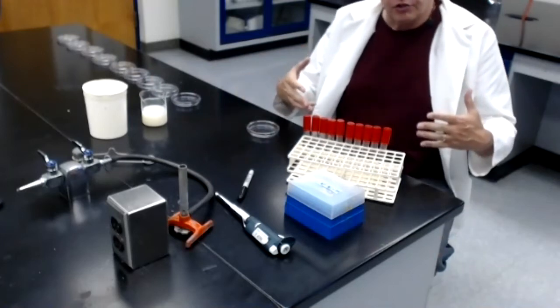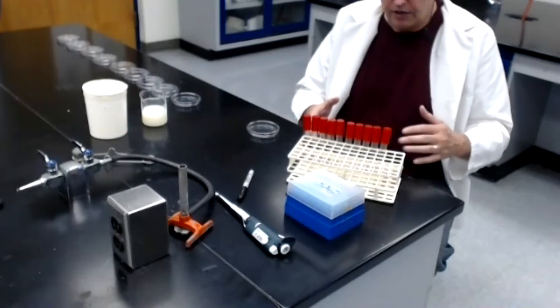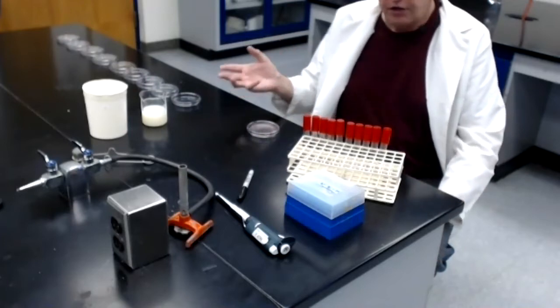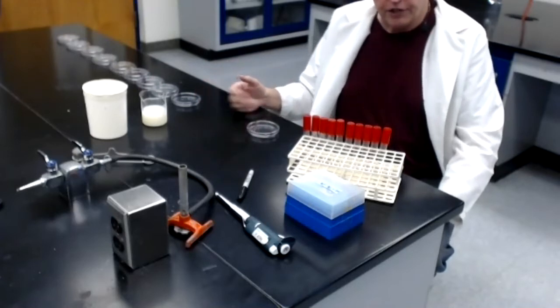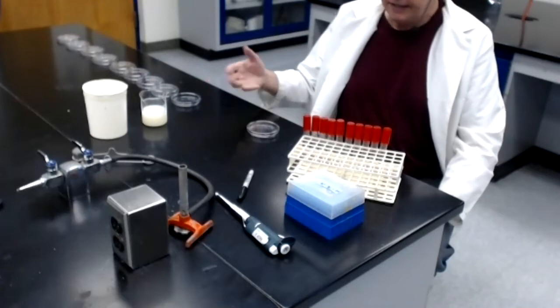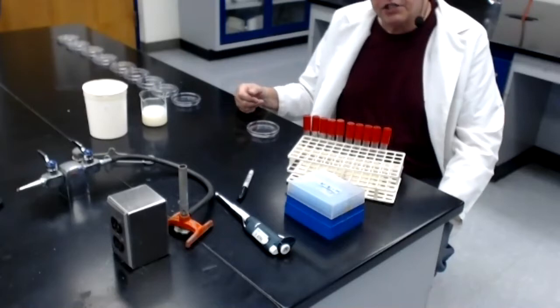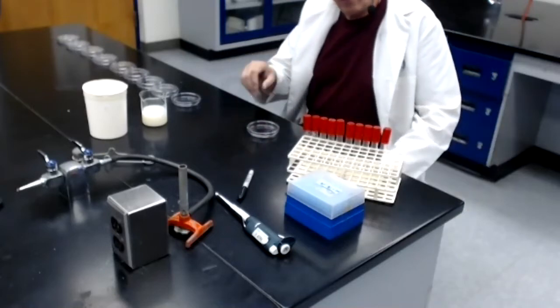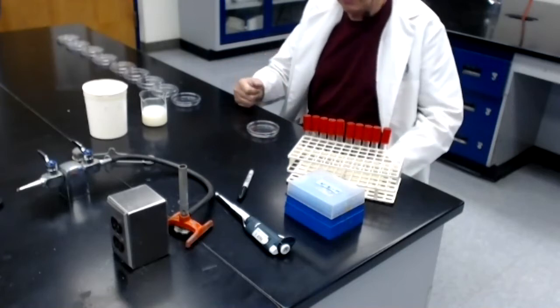I'm going to introduce you to what's called a serial dilution method that will allow you to accurately determine the number of bacteria in any liquid sample that you might run across. In this lab, the liquid sample, of course, is contaminated milk. So how does this work? Again, let me provide an overview of what I'm going to be doing here, and then I will take you through the protocol step by step.